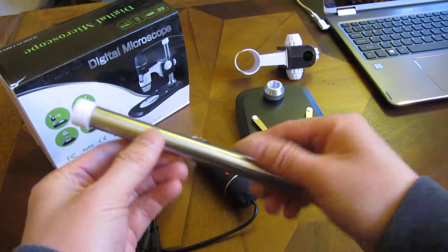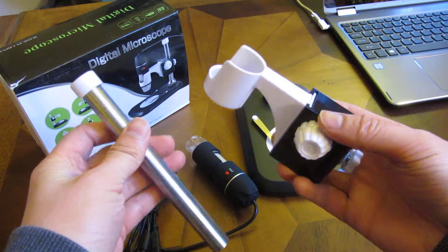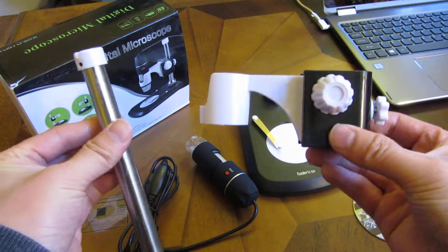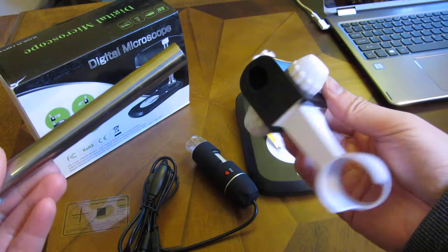This is the vertical up and down, and this is the primary holder of the camera. Keep in mind that this is the upright position, so I will be slipping this in. Let me go ahead and assemble this.